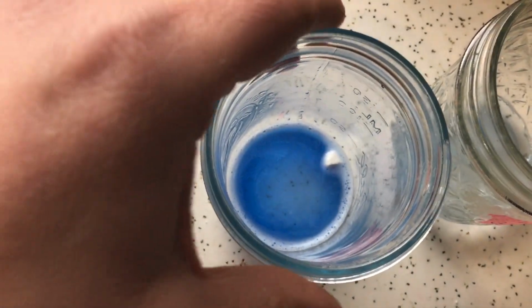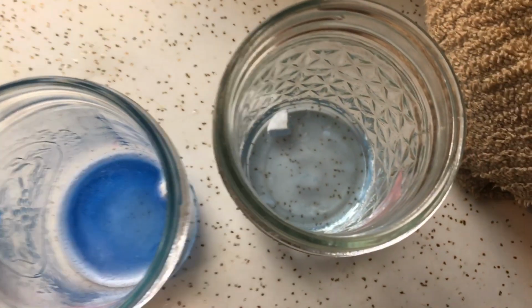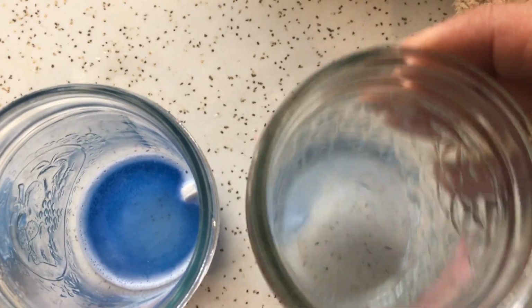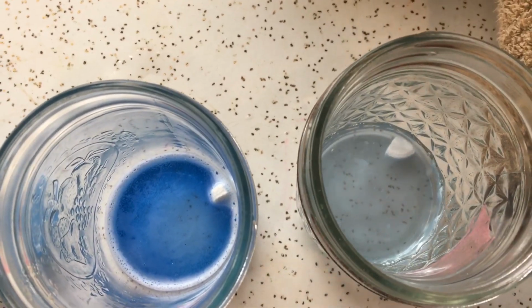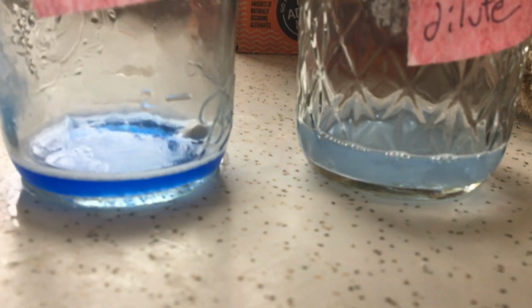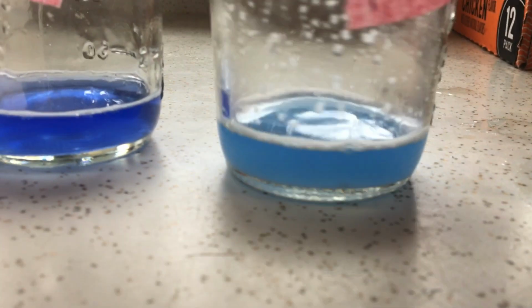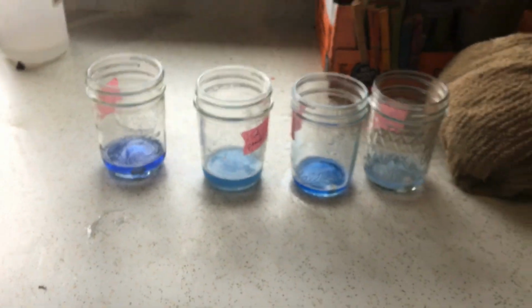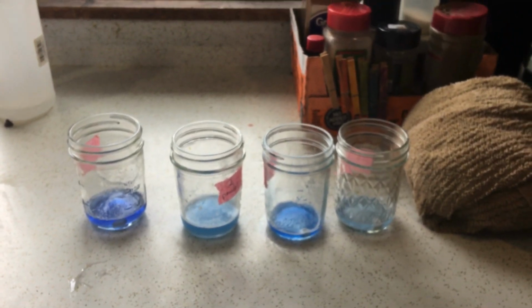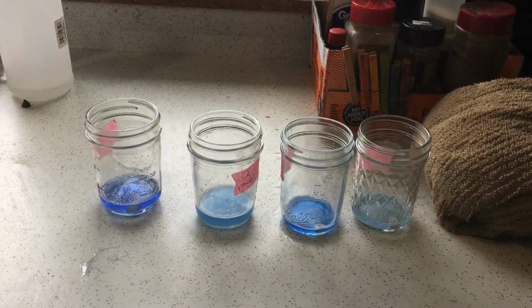Oh, lost my focus there. Okay, so if I swirl this a little bit, yeah, it looks a little bit smaller. This was our diluted one, and to be honest, I really don't see a lot happening there. That's okay. That's probably what the point of the experiment is. So, where'd he go? There it is. Here's our chunk here. It's not even all the way submerged. You're not going to see much in there because it was powdered. And how about this one here? It's got a few little bubbles on it, but not too much. Alrighty. We'll check it out again in a few minutes. We'll probably just go to the 5-minute mark. I'm going to continue to swirl these as we go, and I'll meet you back here in a few.